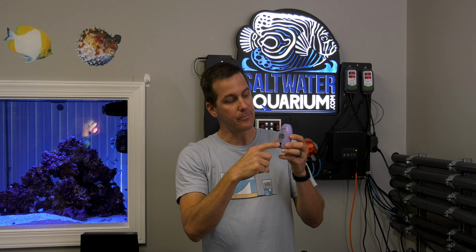Put it back in the checker, and instead of pressing down the button and holding it, which starts the timer, simply press and release that button. That's going to give you an instant reading based off the solution in the vial. Now, some of you might be saying, well, wait a minute. It didn't go through that countdown timer, it's not going to be accurate.